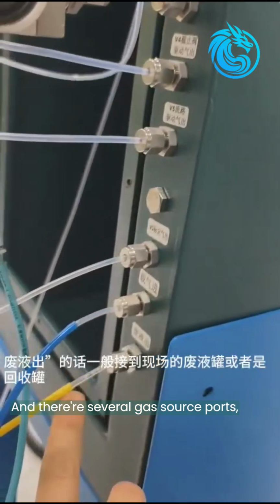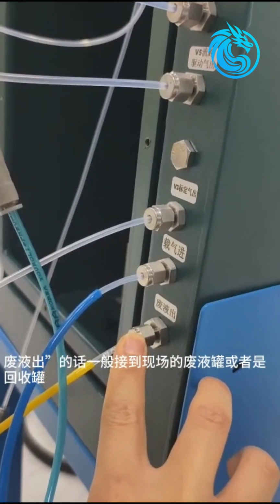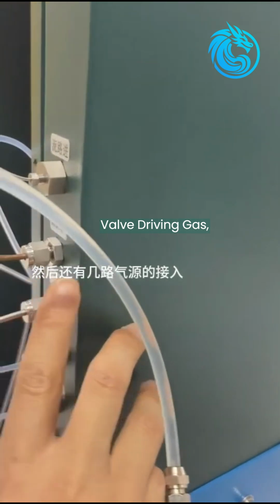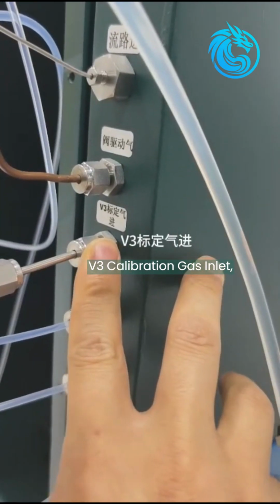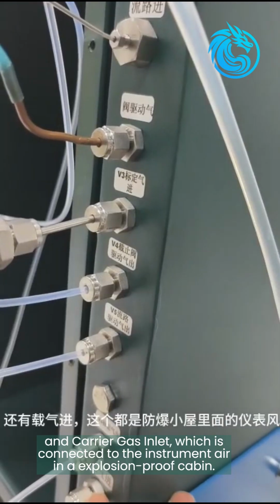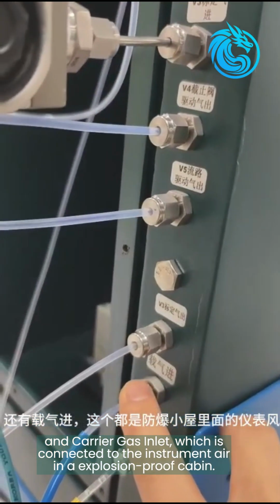And there are several gas source ports. Valve driving gas. V3 calibration gas inlet. And carrier gas inlet, which are connected to the instrument air in an explosion-proof cabin.